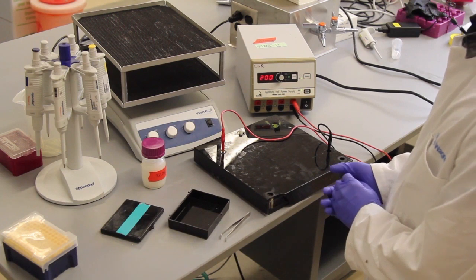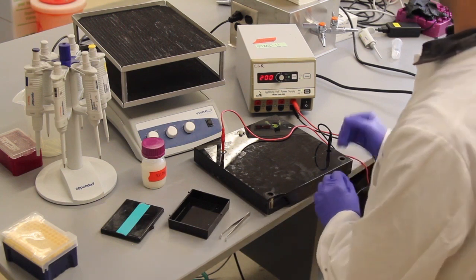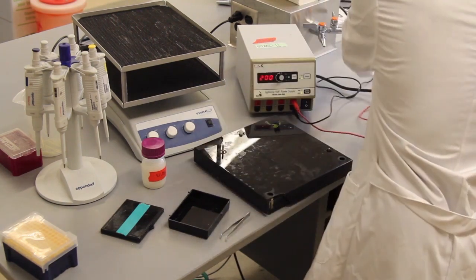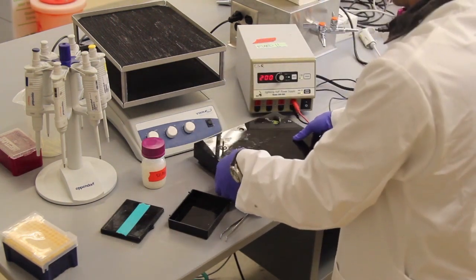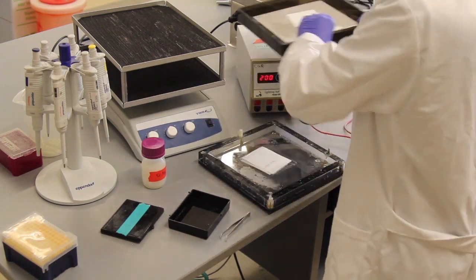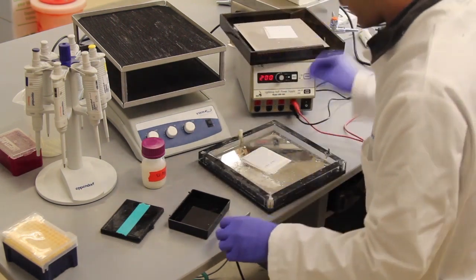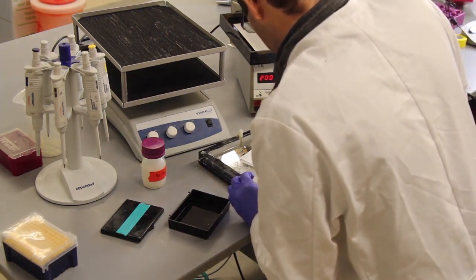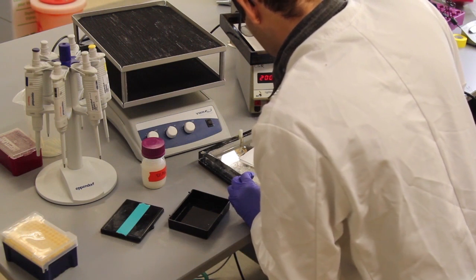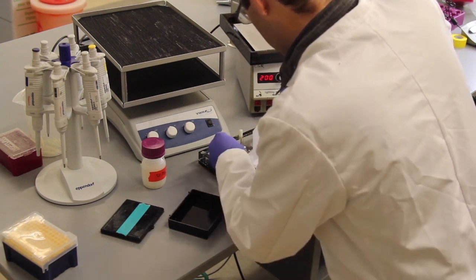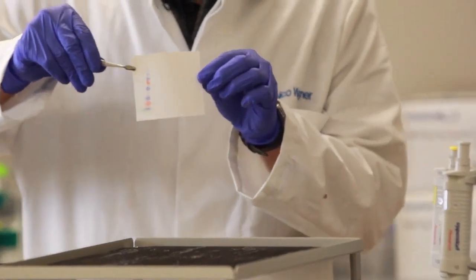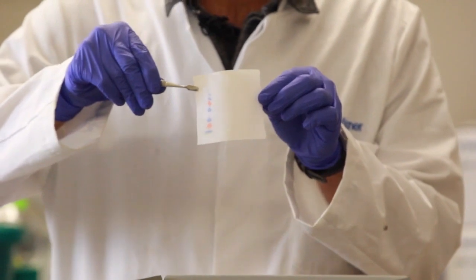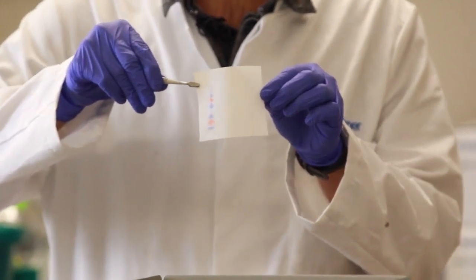This Western has now been transferring for about one and a half hours, which means it's time to stop it. You can disconnect the leads, disassemble the box, and carefully take off the membrane. Looking at the membrane here, I can see the ladder markings transferred over onto it, which means the transfer, the overall transfer step worked well.